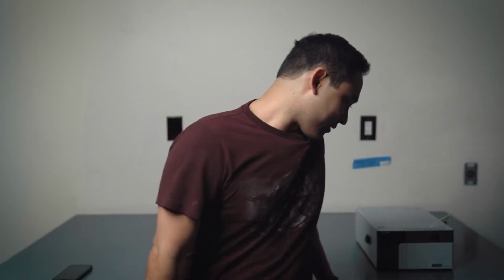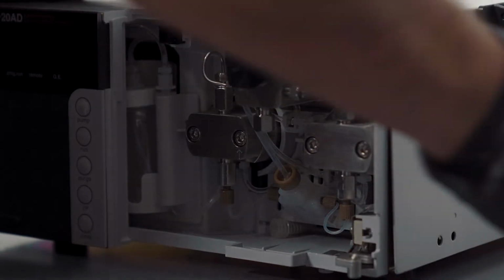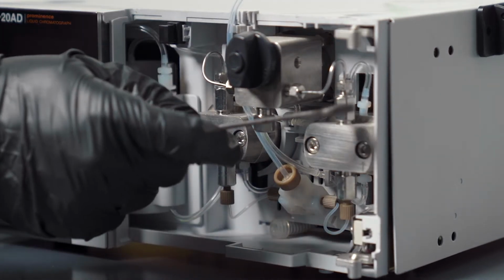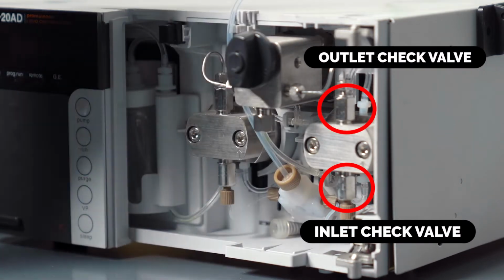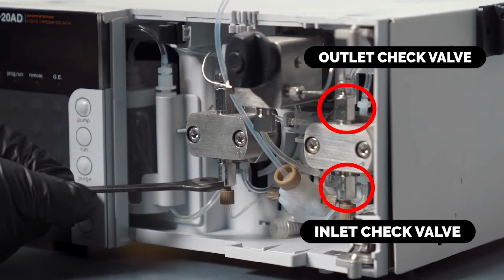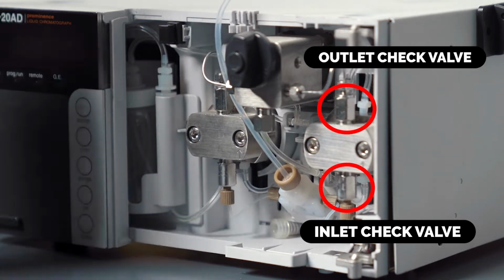So let's take a look here. The first thing we're gonna wanna do is open the door. So again, all the way out and then lift. If you'll notice here, these are the check valves right here. This is a check valve and this is a check valve. This is the inlet check valve and this is the outlet check valve. The solvent from the pumps comes into here and then it goes from here to here. So that's why it's the inlet. And then it goes to the outlet here. The inlet has two notches, the outlet has one for this particular pump.